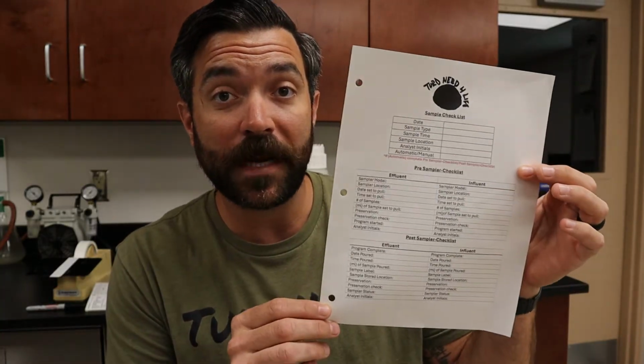Well, other than just taking your word for it, I can actually go to my handy dandy filing cabinet and pull out 3 to 5 years of these records where we physically go out there and mark on this checklist what I'm doing with our sample. This little piece of paper right here can come in very handy regarding your samplers out there. I can tell you when I did my pre-sampler checklist and my post-sampler checklist. I can tell you exactly what I set it to. I can check the verification on the temperature, and then I initial at the bottom. All of these things can be very important to you as an operator and come in handy if there's ever an issue regarding your samplers.